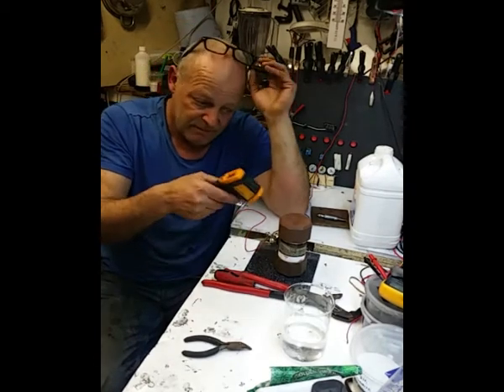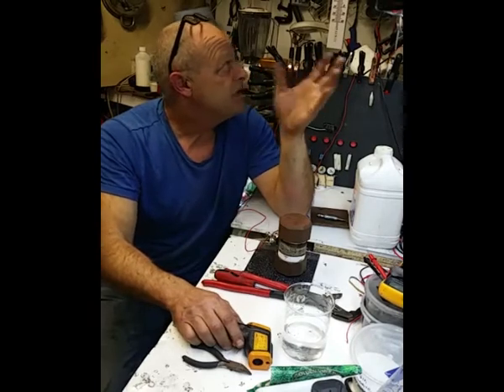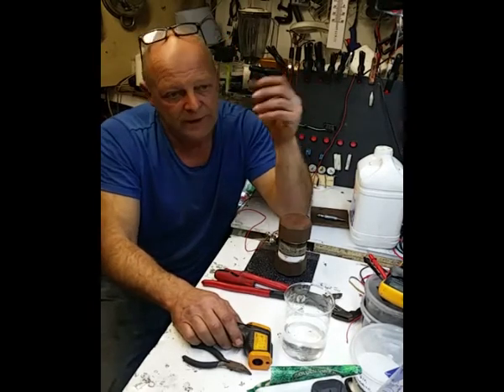Okay, so that's maintaining its temperature, 6.3 volts, 5.8 amps.